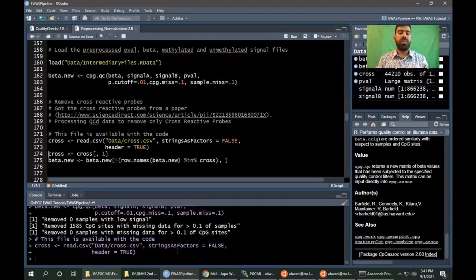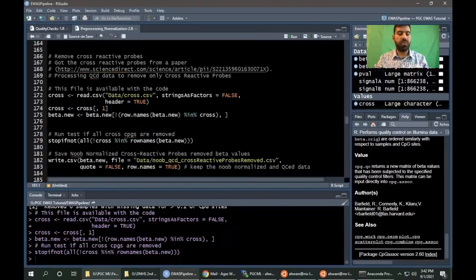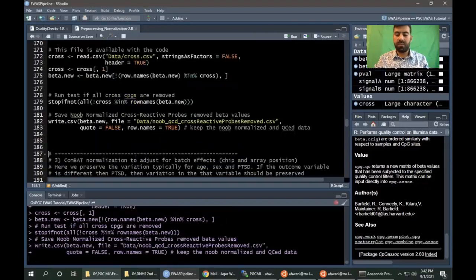Next, we need to remove the cross-hybridized probes, those probes that match more than one location in the genome. Those are recommended to be removed. You can refer to this paper, where it has probes that are known to be cross-hybridized. We will remove those probes and we will save the data again for future use.